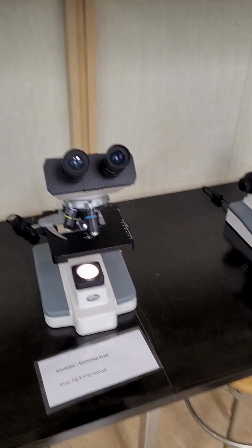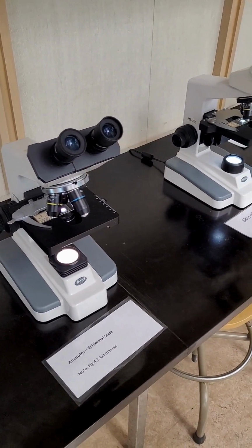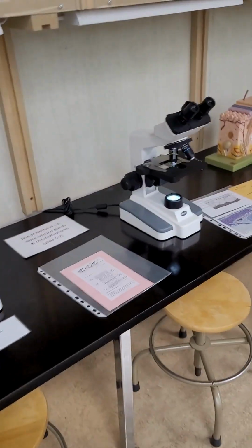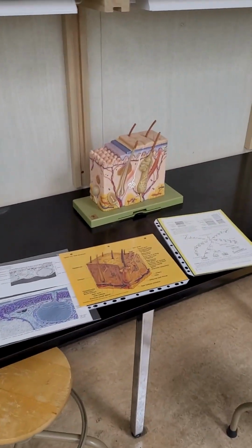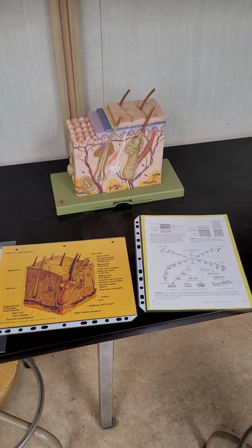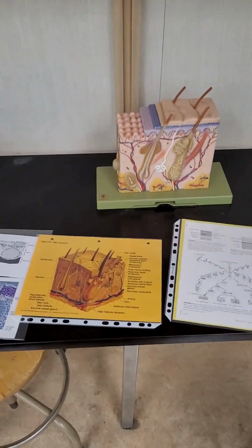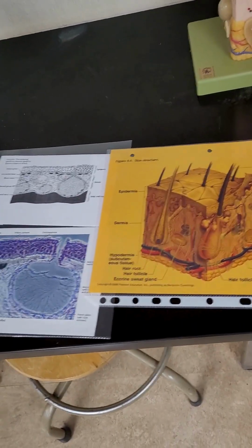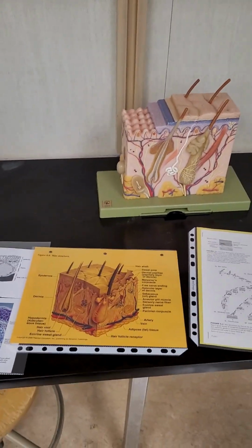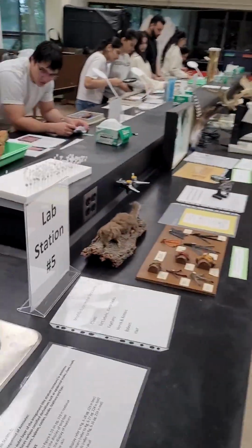So these epidermal derivatives make scales. They make the cornified epithelium of keratin in a human as well, and they also make hair and feathers. And in some structures they interact with the underlying dermis, which is mesodermally derived, to create bigger structures too. And so we can go and have a look at this in our station 5. So here you're just seeing the epidermis and the dermis with the basal lamina between the two as a membrane. We move this way to station 5.